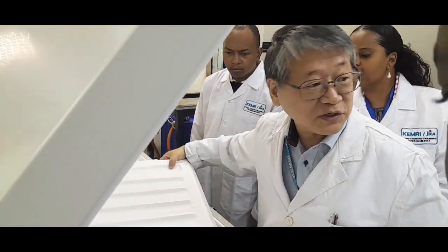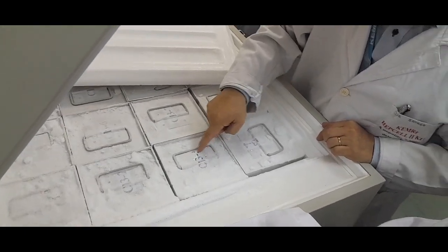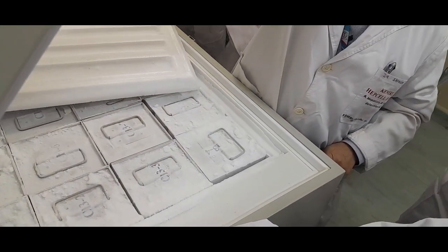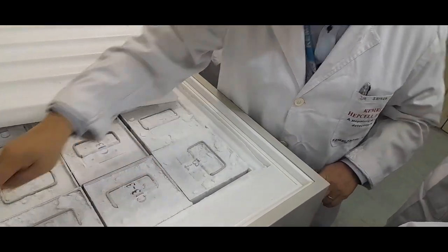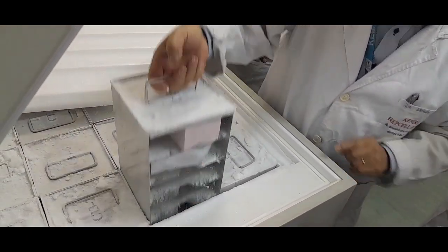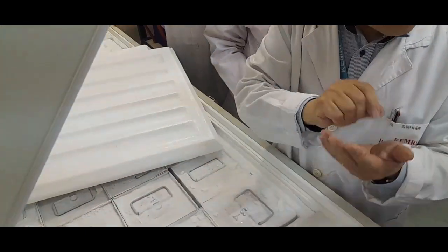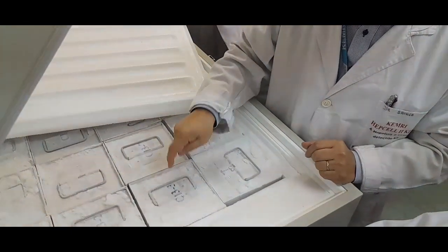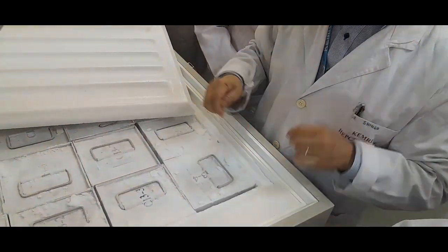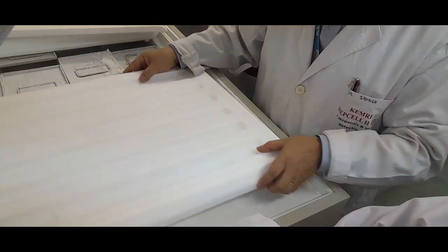Okay, and then all these chest type freezers have an inventory rack like this. So you can see that CH3-3 means channel 3. This machine is channel 3. And then 3 is 1, 2, 3, 4, 5, 6, 7, and then the level is written here. So if you record channel 3-3-1, it means here. So you can pinpoint where the sample is.